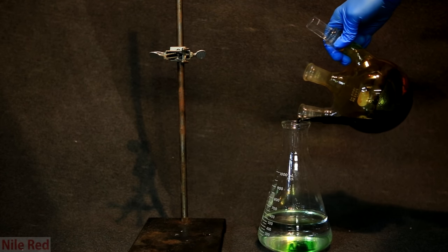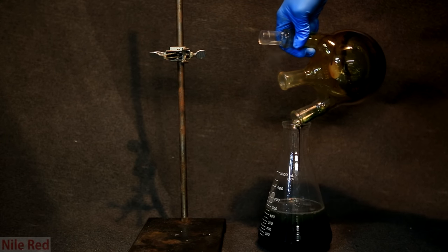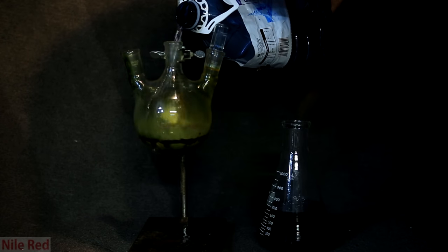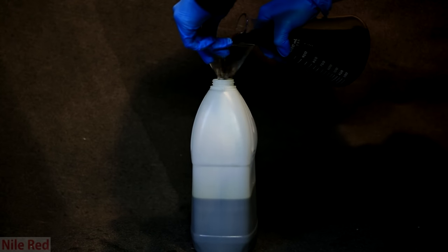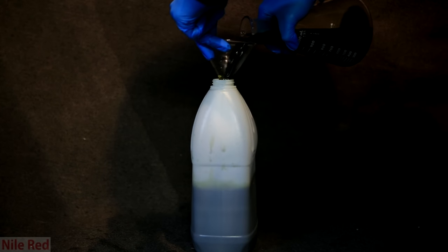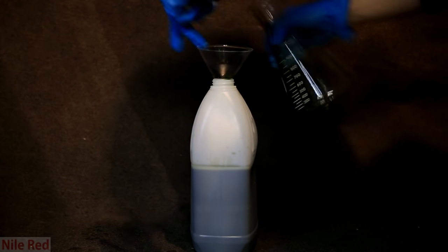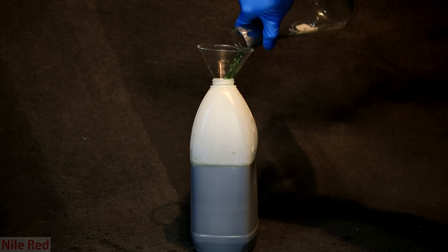The remains of the distillation flask was poured into a sodium sulfite solution. The flask is cleaned up with a little bit more water, which is also added to the Erlenmeyer flask. The solution is going to still be really acidic, because we didn't do any acid neutralization, and you should be aware of that. Anyway, I put all my chromium waste into my chromium waste bucket.